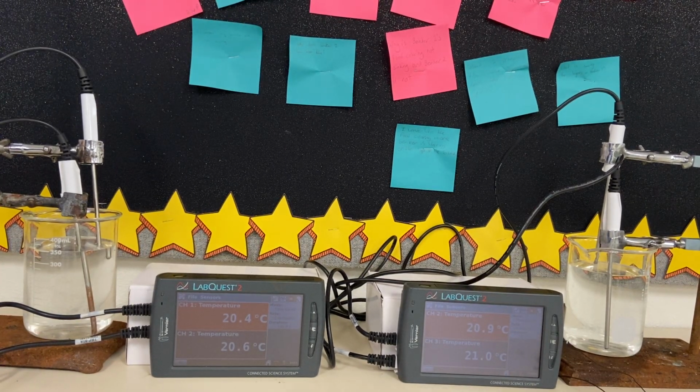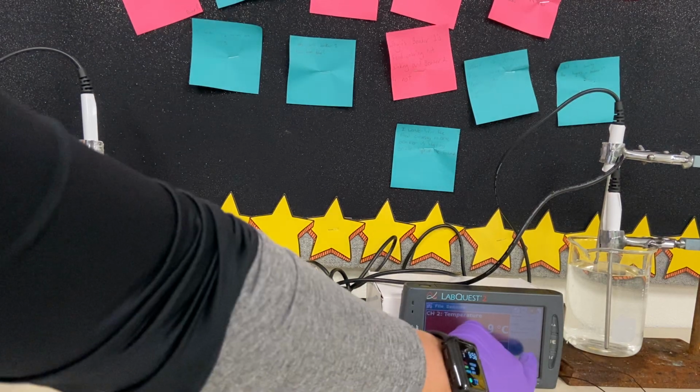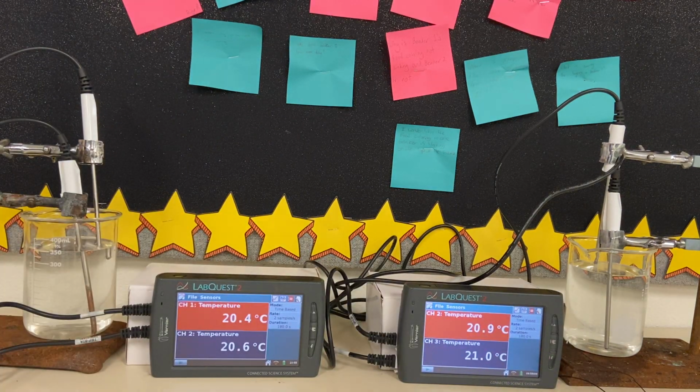Okay, this video is the blue ice activity. What I'm going to do is go over the setup with you and then start the experiment so that you can see the data that's being collected.